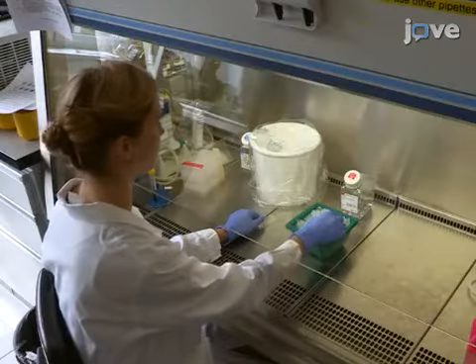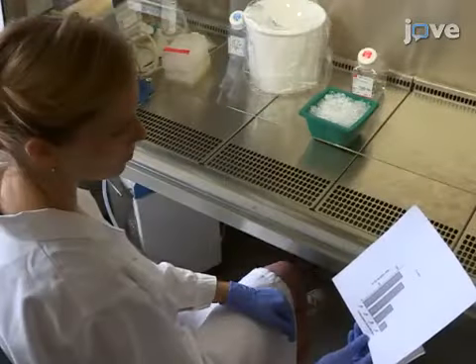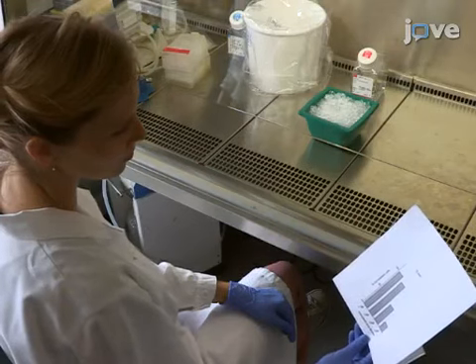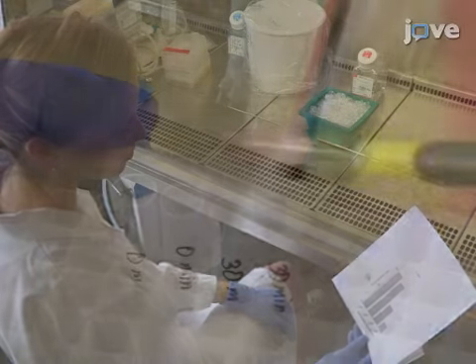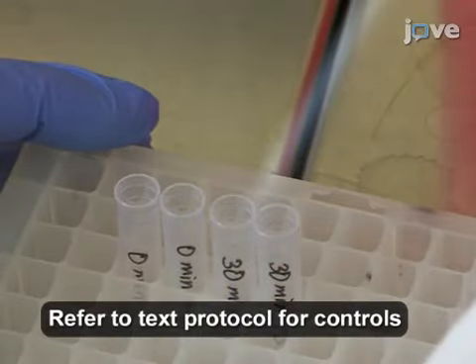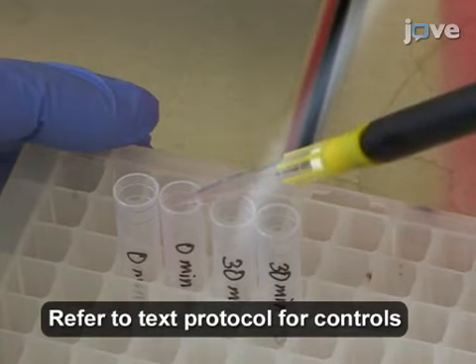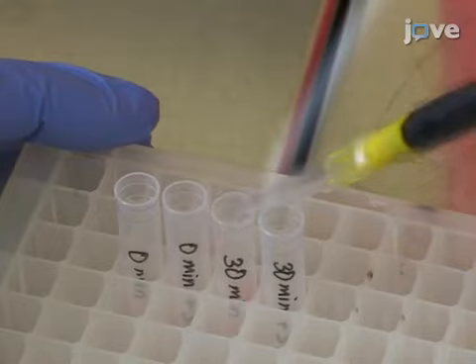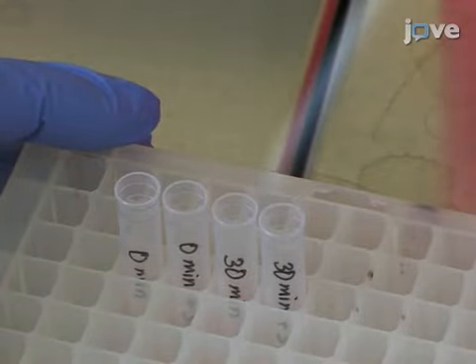After generating biotinylated virus and determining the required amounts of the labeled virus, streptavidin, and Cy3 labeled streptavidin according to the text protocol, prepare 4 deep well tubes, each containing 200,000 A549 cells. Label the tubes as 0 minutes, 0 minutes plus STV, 30 minutes, and 30 minutes plus STV.